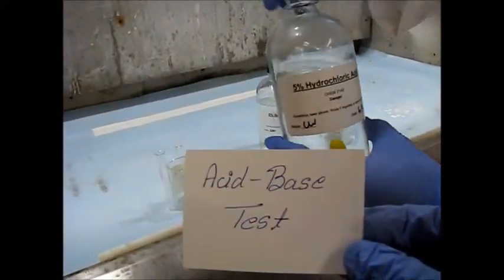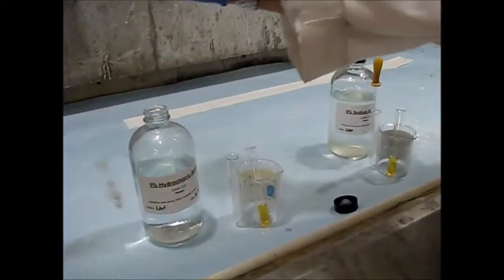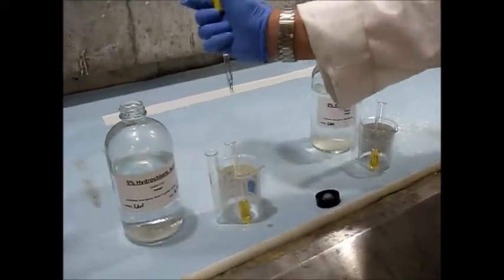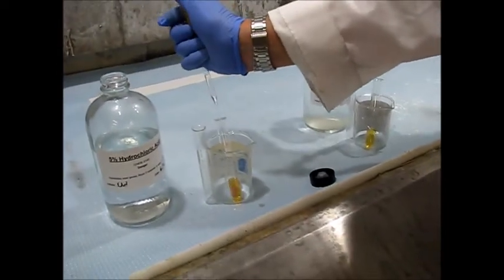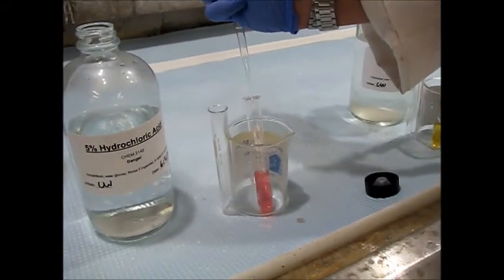So we're going to do the acid-base test. So here we're going to add hydrochloric acid into a little bit of our sample. Should turn red. Yeah, look at that. Cool. So we've confirmed that HCl is an acid.